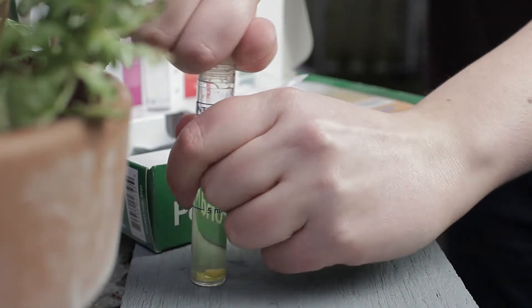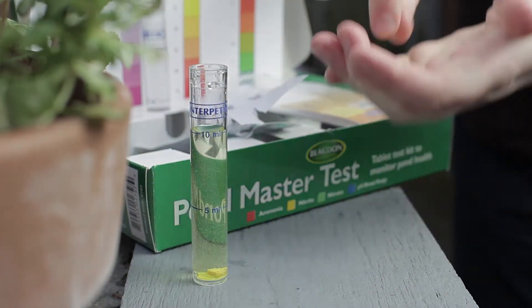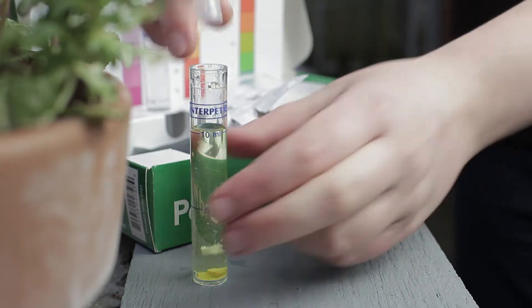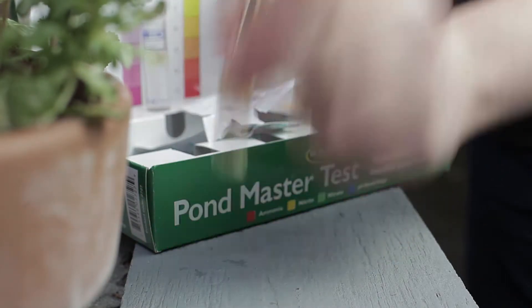Add one Nitrate 2 tablet. Recap the vial and immediately shake for 60 seconds.